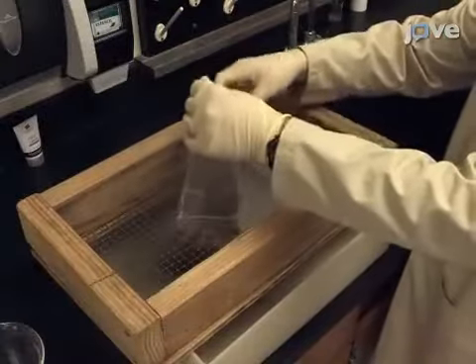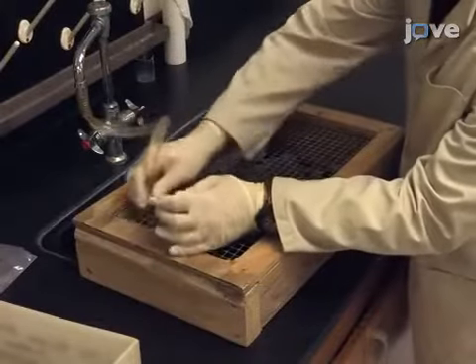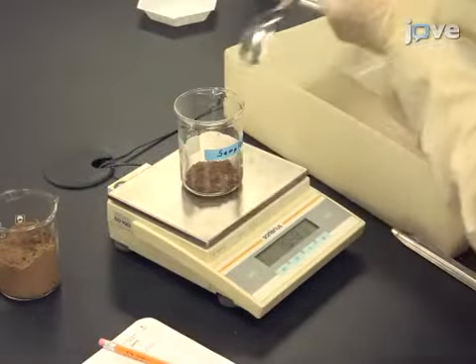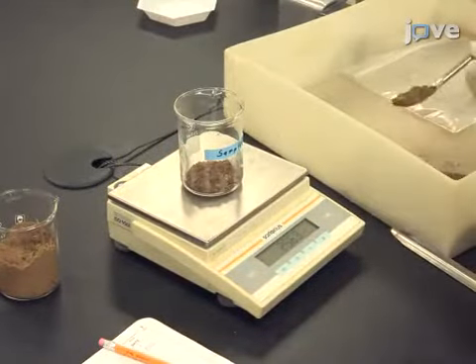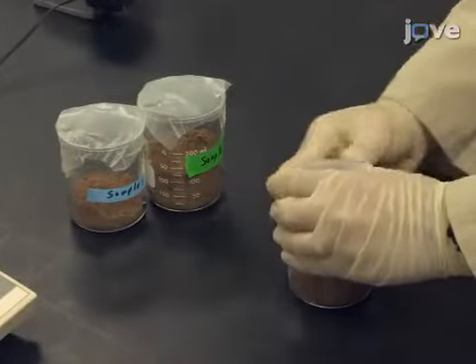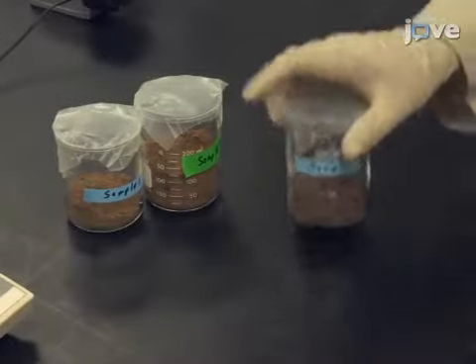Once field work is completed, sieve the soil samples. Clean the mesh with water after sieving each sample. For each composite soil sample, place 3 individual 100-gram samples into beakers. Cover the beakers with laboratory film and pre-incubate the beakers at 25 degrees Celsius for 10 days.